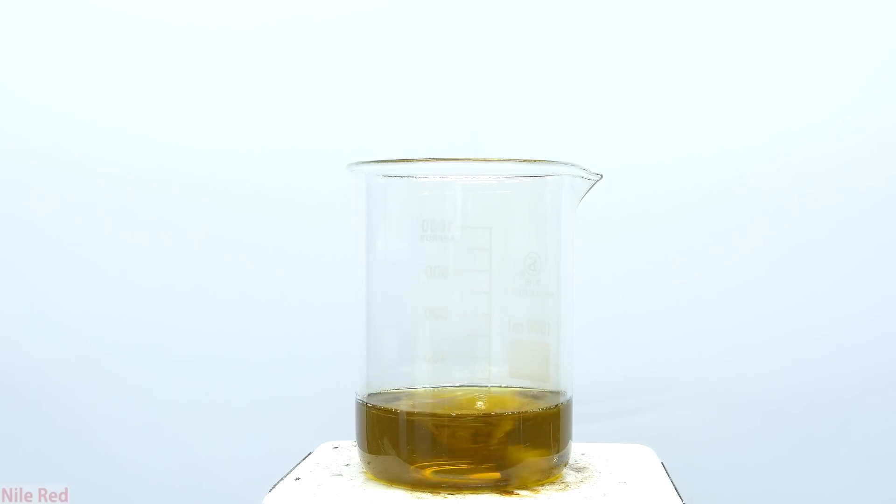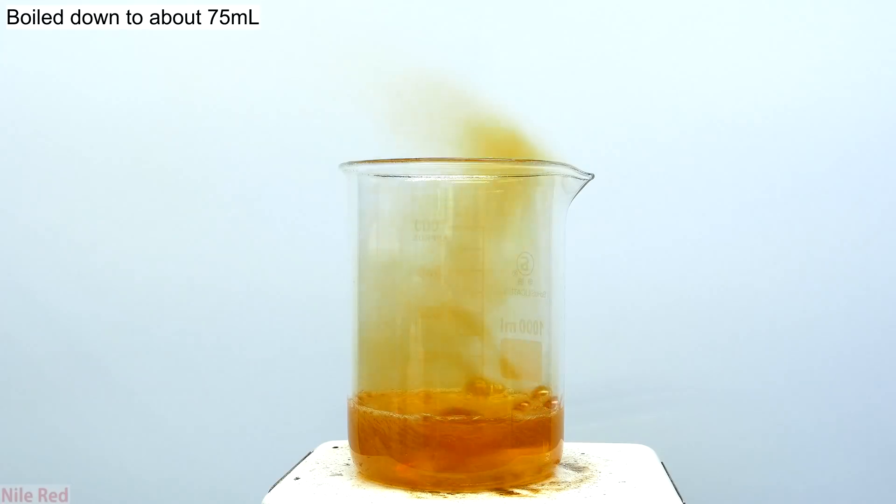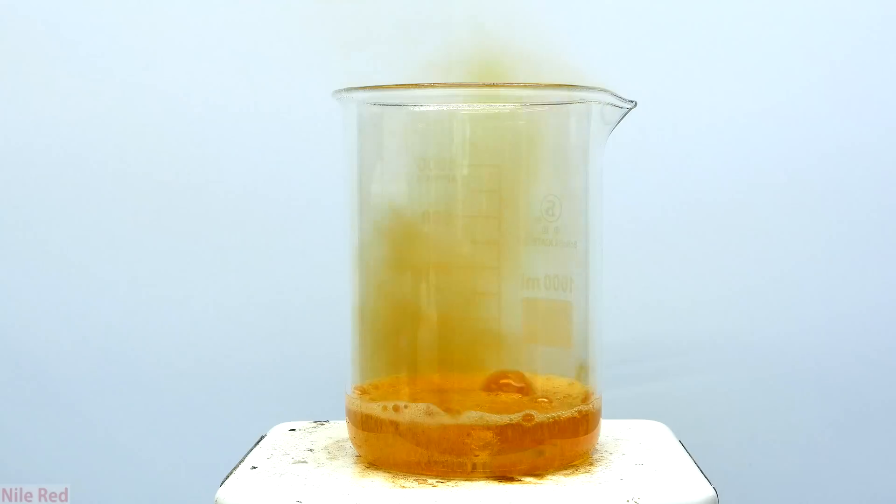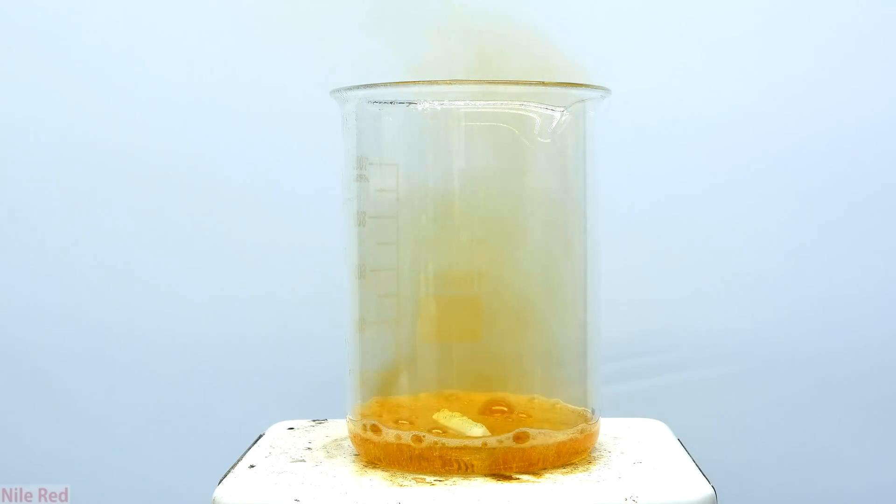After around 10-20 minutes, the reaction should have died down, and at this point we begin to heat things again. The goal now is to boil down the solution to about 75 milliliters. It's really not important to get it down specifically to 75 milliliters, and I think anything between 60 and 90 is probably good.